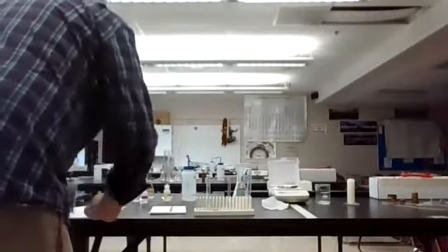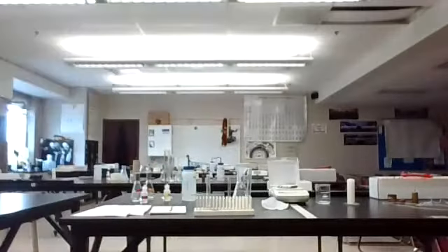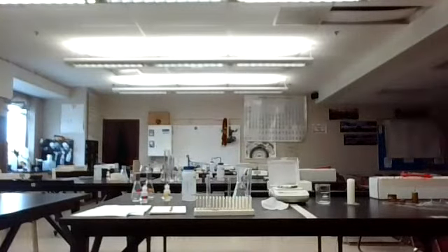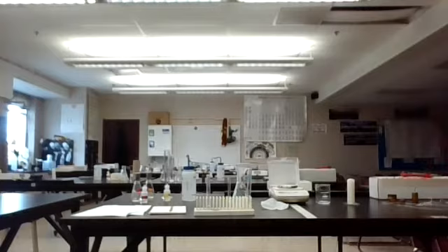The last little part of the lab is just a fun little part. This is where we take a penny and see what happens when we mix it with a little bit of vinegar. So we've got to watch over here, get that penny, and get some salt. Now you guys at home can do this lab pretty easily yourself. Okay, just take a little bit of salt. I have my water in here, so I'm just going to dump that out. It's not going to cause an issue.